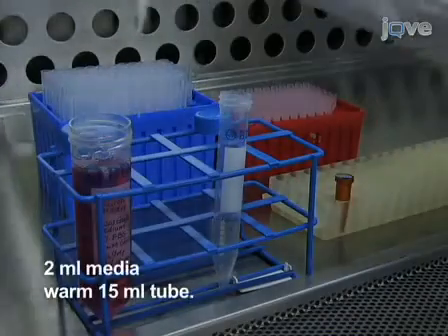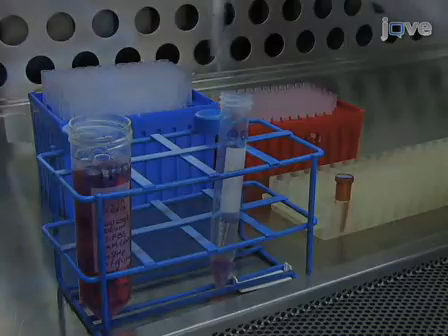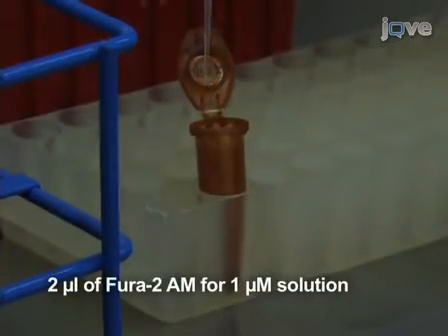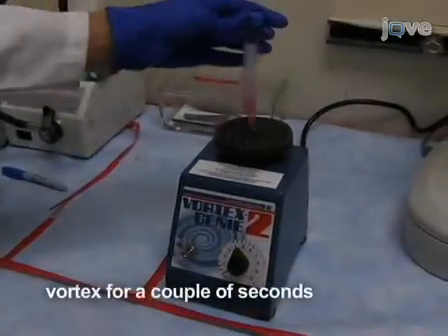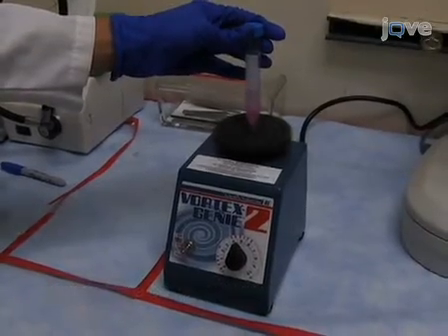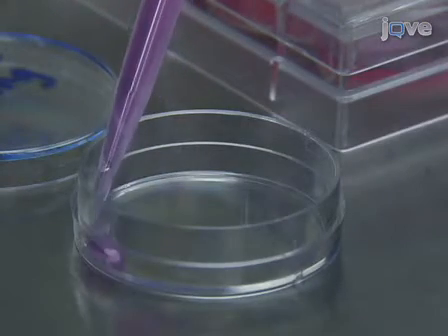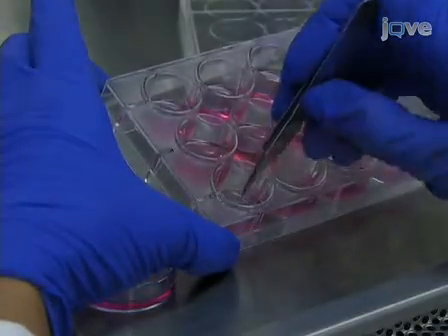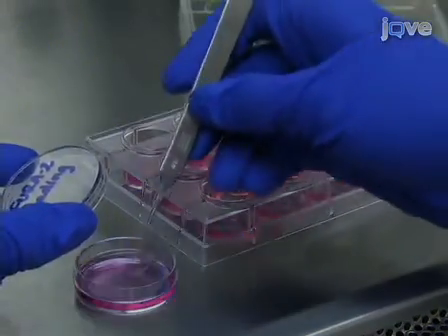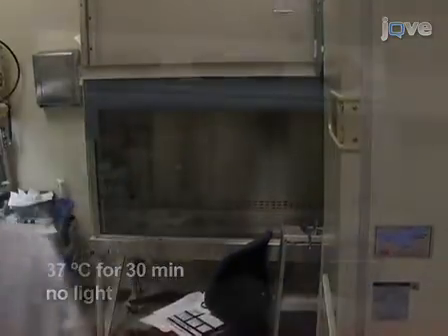Next, aliquot 2 milliliters of culture media into a 15 milliliter conical tube warmed to 37 degrees Celsius. Then add 2 microliters of Fura-2-AM stock to generate a 1 micromolar Fura-2-AM solution. Vortex the solution vigorously for a couple of seconds. Transfer this loading solution to a 35mm tissue culture dish, and using forceps, place the coverslip with the cortical neurons into the dish. Incubate the neurons at 37 degrees for 30 minutes in a dark incubator, timing the incubation precisely.